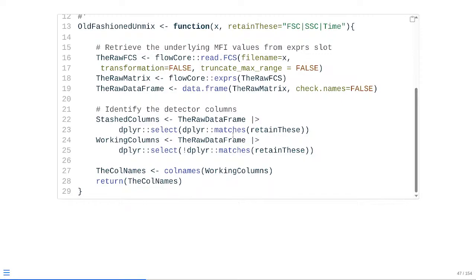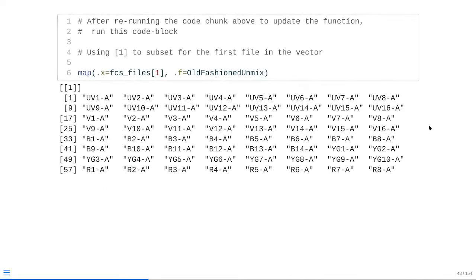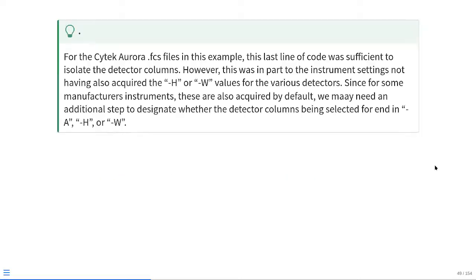Basically, right where we had stashed columns, we just copy this line here, go ahead at that point, paste it, change the name to working columns, and we're just adding in that little exclamation sign to flip the order. So if it matches forward scatter, side scatter, and time, in that case it's not going to be kept. If it doesn't match them, it's going to be kept and it's going to be saved to working columns. And as you can see at this point, we're successfully isolating out our individual detector columns that we're going to need for the unmixing process. So, in the case of the Cytek Aurora FCS files that we have for this example, this very last line of code would have been sufficient to isolate out the detector columns and we could proceed downstream to unmixing.